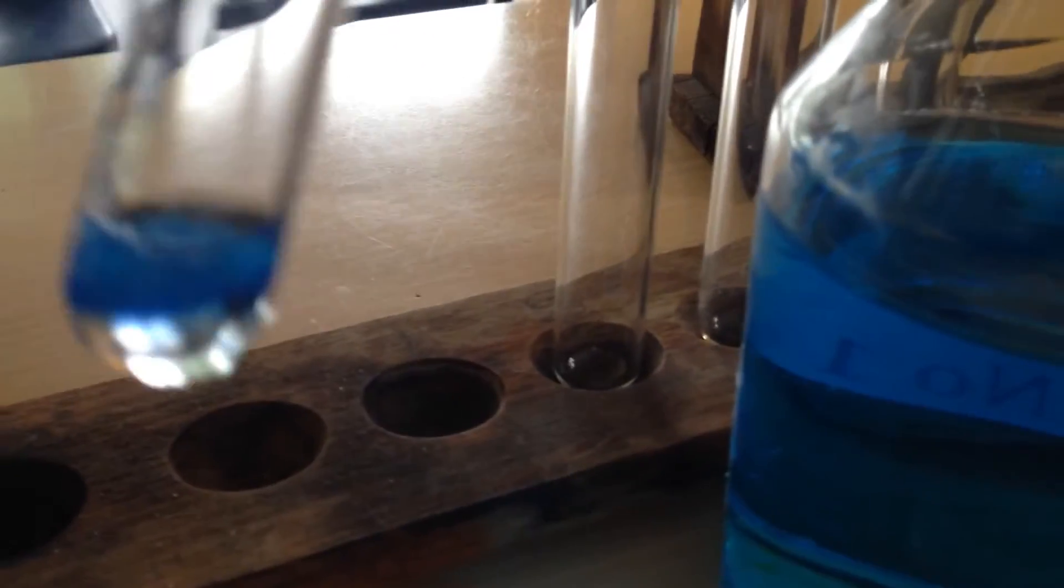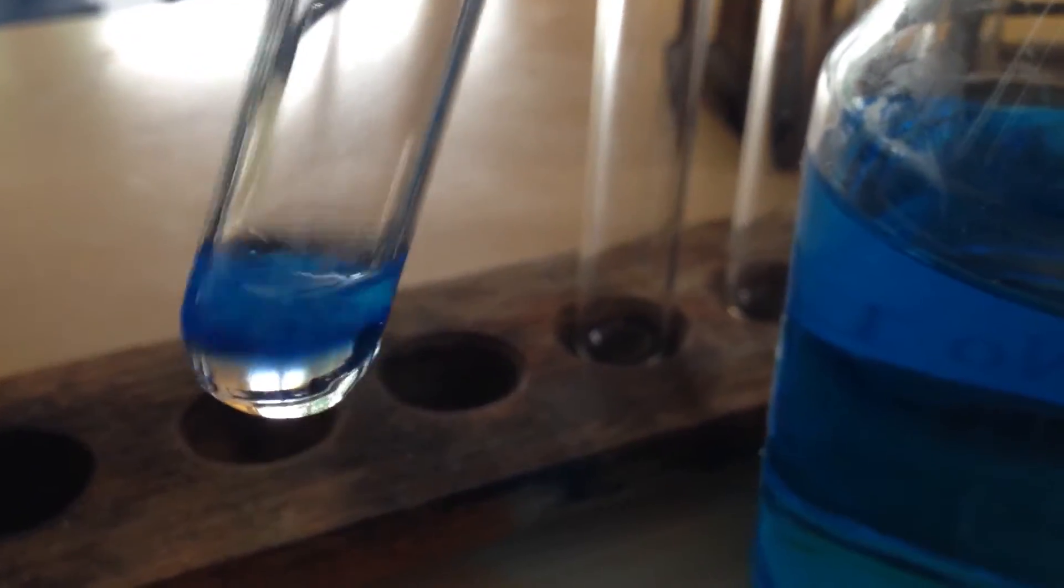Obviously you should do it much more effectively than just using little plastic pipettes. And you can see that after I mix it, this is going to be a lovely dark blue solution.